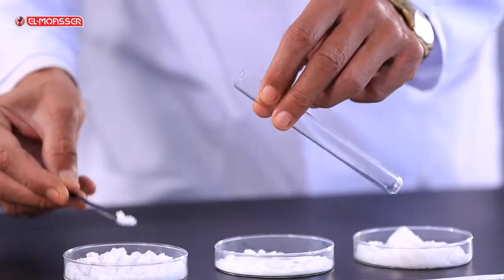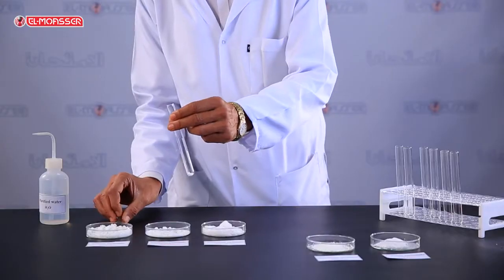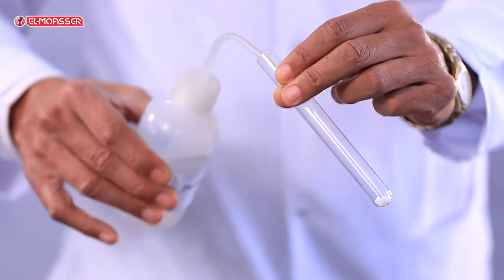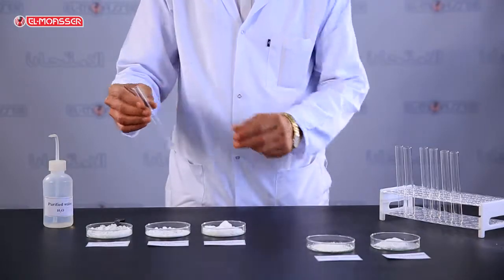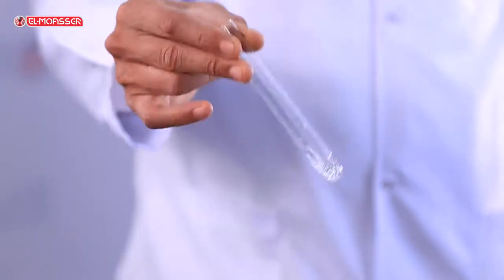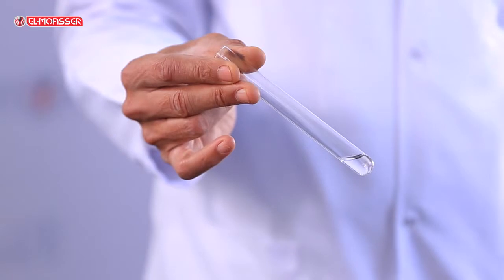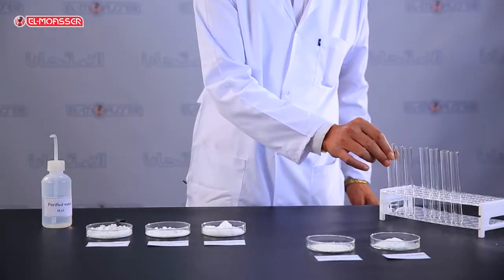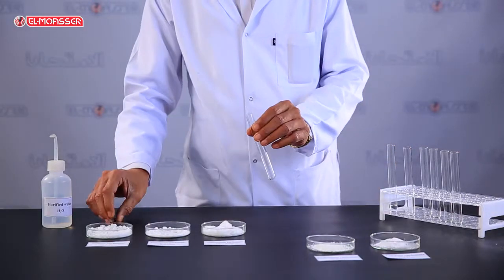Add a small amount of sodium carbonate into a test tube, then add distilled water and shake. What do you observe? Sodium carbonate is soluble in water. Repeat the above step using potassium carbonate.